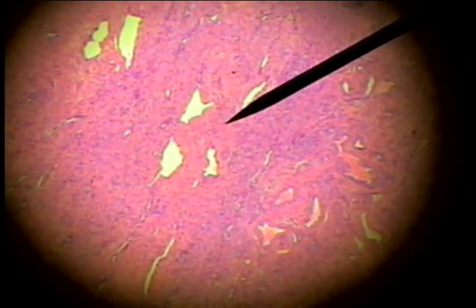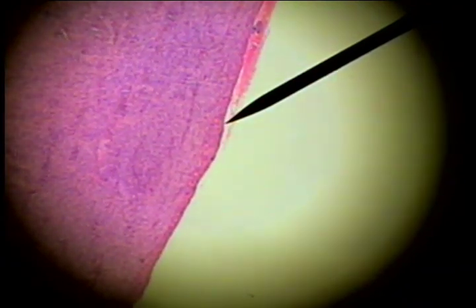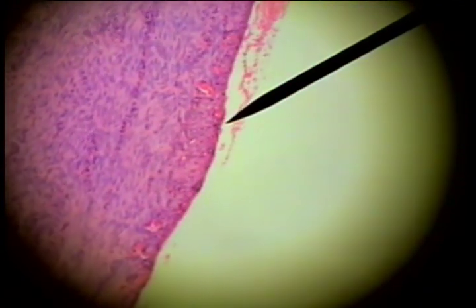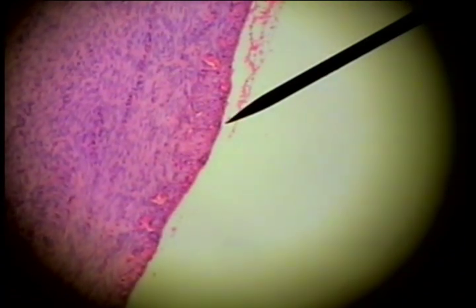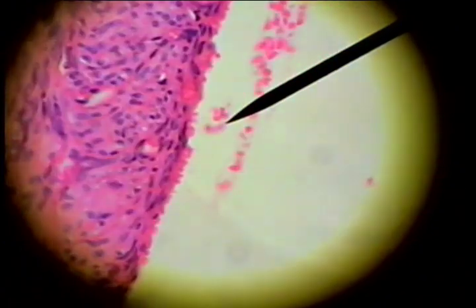This is smooth muscle and it's a very thick layer made of many, many swirling and interlacing patterns of smooth muscle with arteries and veins. And then finally an outer very thin covering of serosa, and if we look at that under high power we can see this very thin layer right here with this almost simple squamous epithelium.